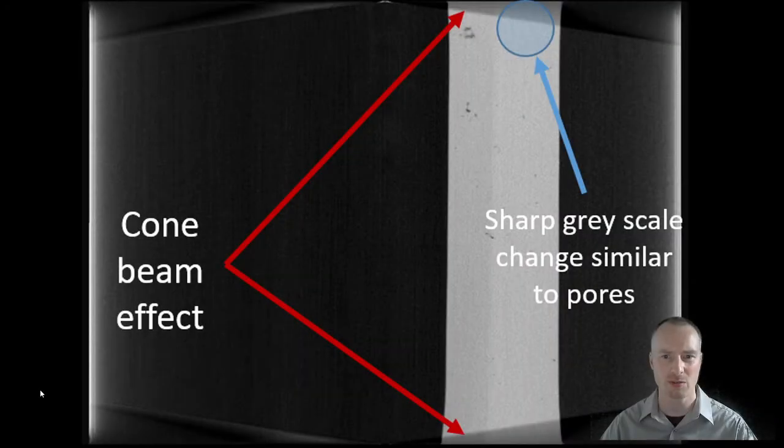In X-ray computed tomography, the first reconstruction artifact that we should be considering is the cone beam effect. We can see in this example the cone beam effect starts at the centre of the ortho slice and moves diagonally downwards towards the outside edge. The same can be seen at the bottom of the ortho slice where it starts at the centre and then moves diagonally upwards towards the outside edge.